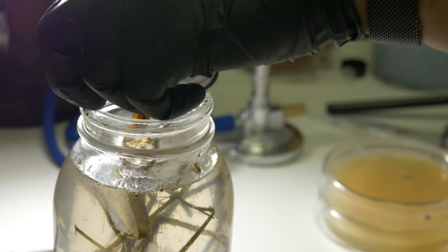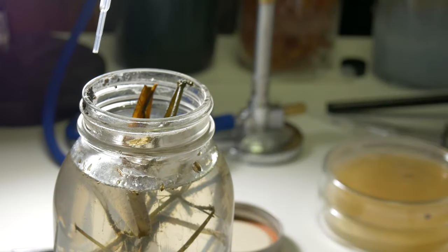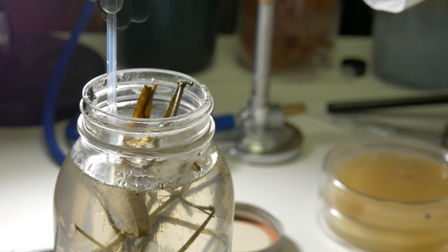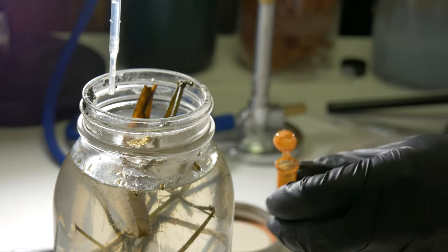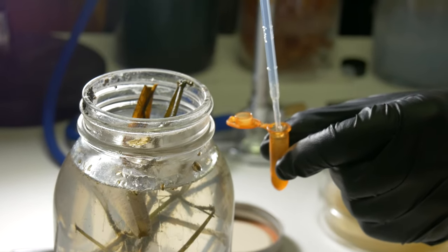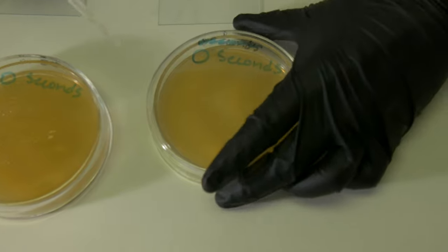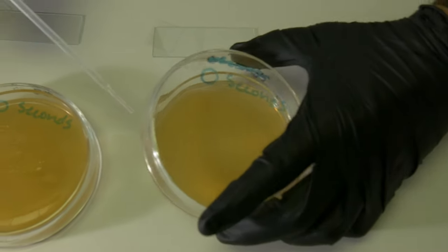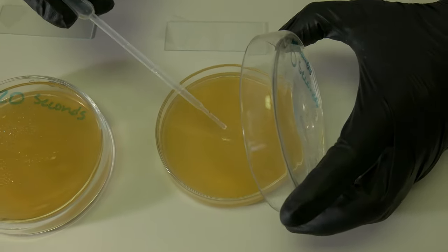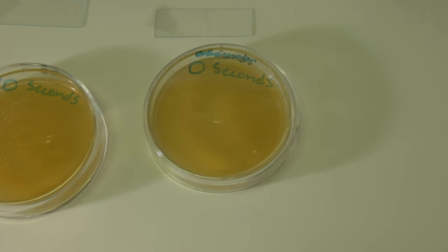Step 1 is to take a small sample from our pond water jar. I elected to put it in a small Eppendorf tube. I elected not to shake up or agitate the pond water at all — I just took it directly from the subsurface layer. Next I added about 100 microliters of the raw pond water to this LB plate, and also added a small droplet to the microscope slide so we can look at it under the microscope.